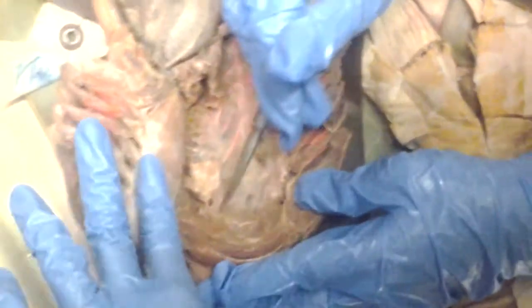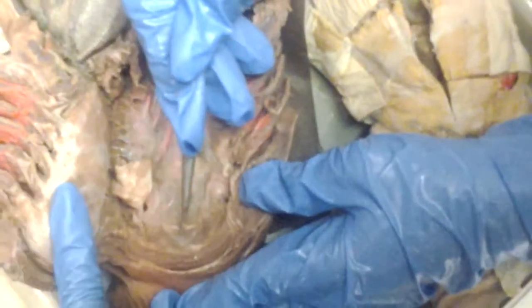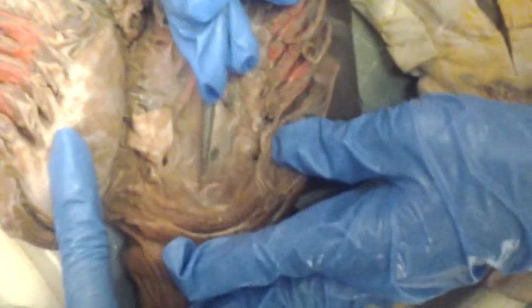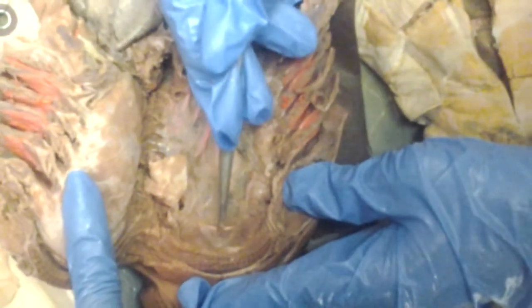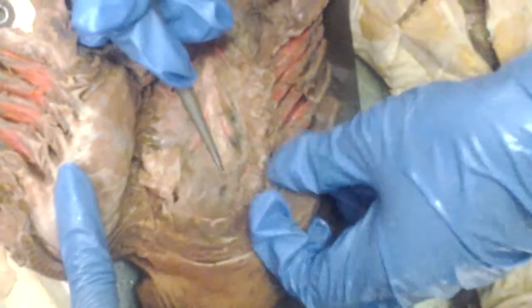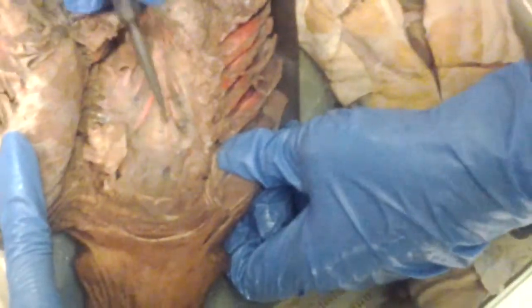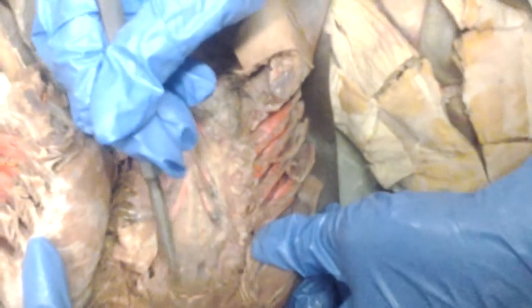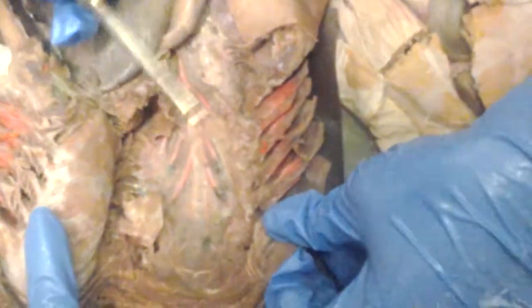Look up. The paired dorsal aortae are up here. And then in that space, this is the internal carotid artery. So these are the internal carotids here, and it becomes one internal carotid. So these are the paired lateral dorsal aortae, and these are the internal carotids. Paired lateral, for my class, don't worry about it.